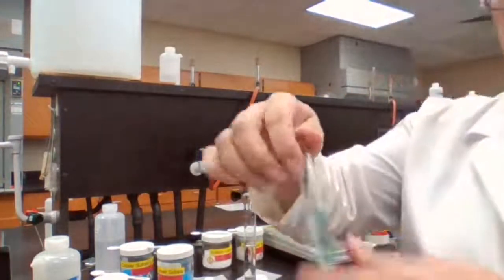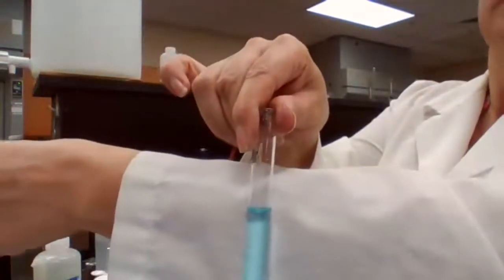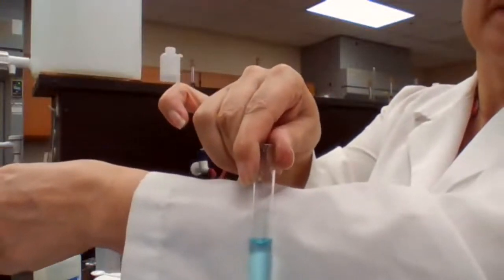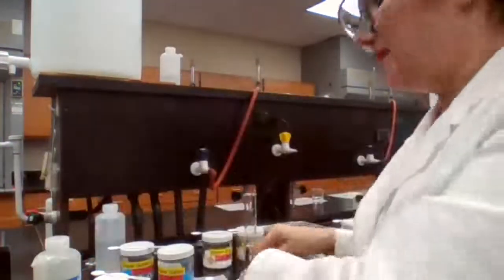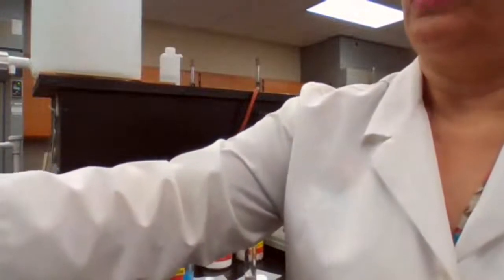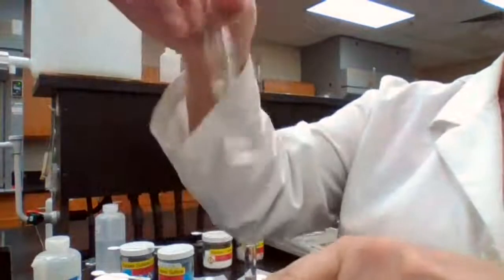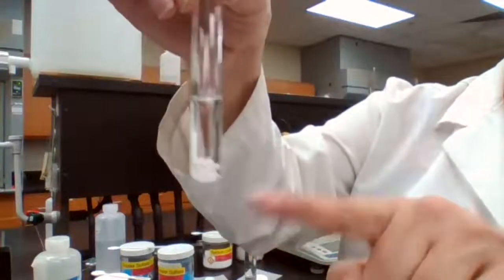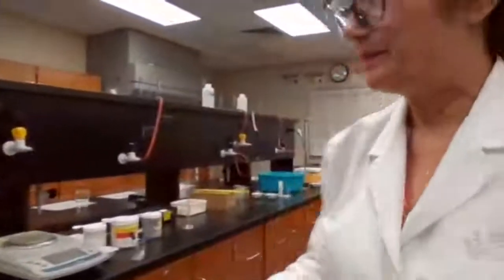Okay. See the blue color solution that was formed. The copper sulfate, because it's a soluble ionic compound, is polar. It did dissolve in water, but naphthalene did not dissolve in water. Naphthalene is floating on top also, and no matter how much I mix it, nothing is happening because it's non-polar. Then we have the naphthalene that I'm going to test with toluene.